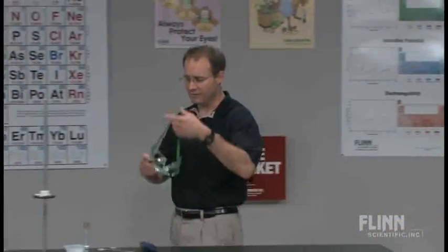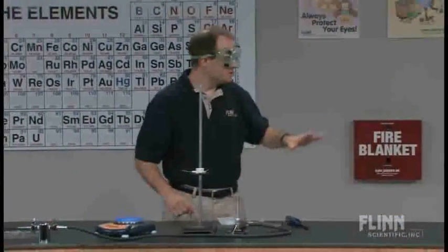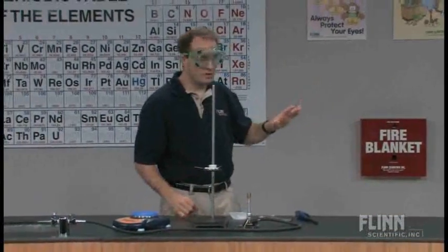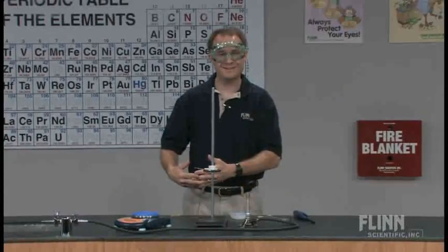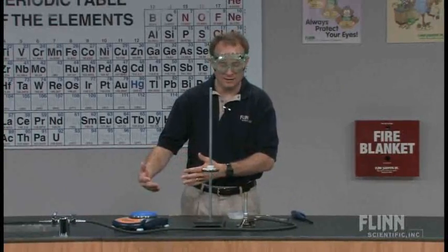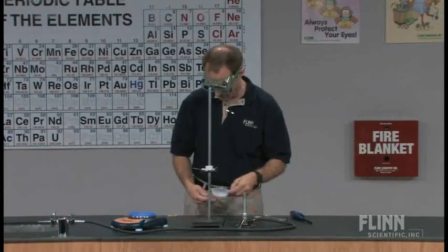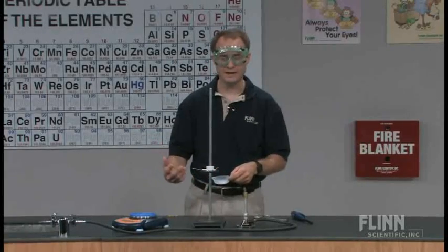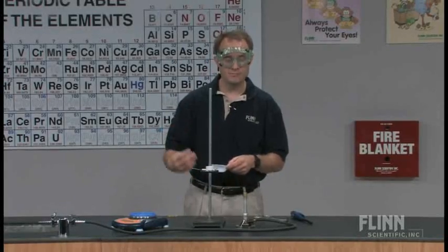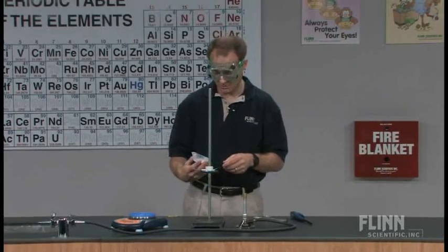Over here you'll see the setup that we have. To answer the question of the 2.00 grams of product at the end, if you do the calculations, you find that you need 3.17 grams of baking soda — sodium bicarbonate.